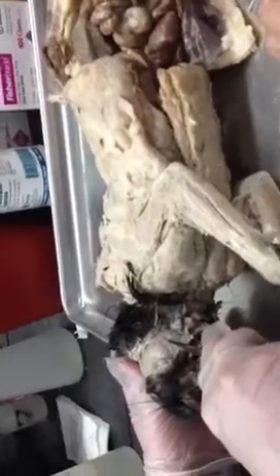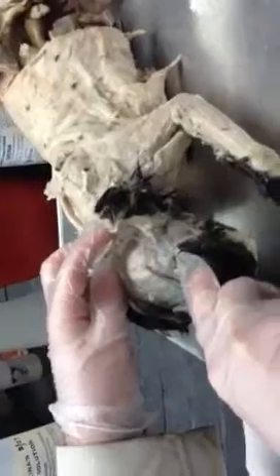Going back to the first dissection we did, the cheek muscle is called the masseter — that's one of the chewing muscles. And then the muscle behind the ear on the upper part of the head is called the temporalis, because it originates on the temporal bone. The masseter and the temporalis are both involved in chewing, moving the mandible.